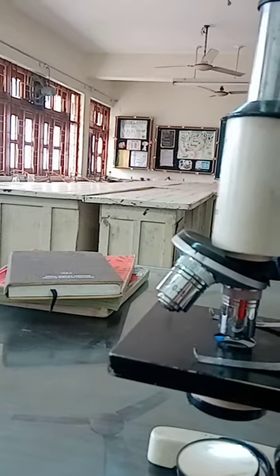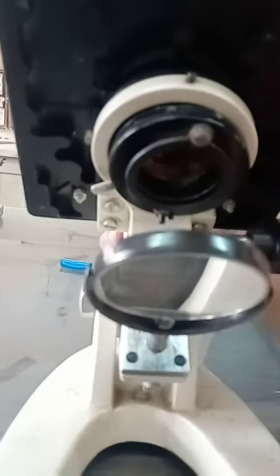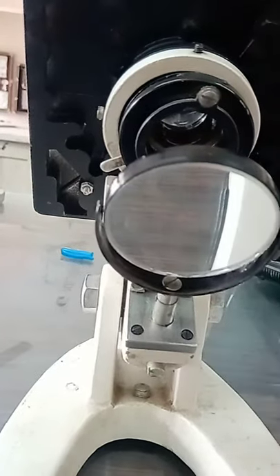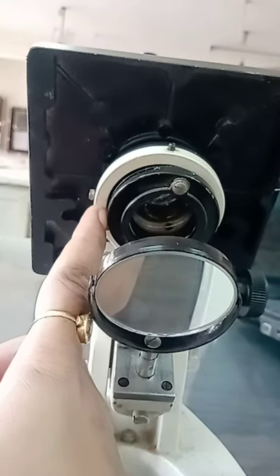A diaphragm is there. It is attached to the sub-stage and regulates the amount of light falling on it. I am showing you the diaphragm directly. This is the diaphragm of the microscope. We can adjust the amount of light falling on the slide with the help of this clip.